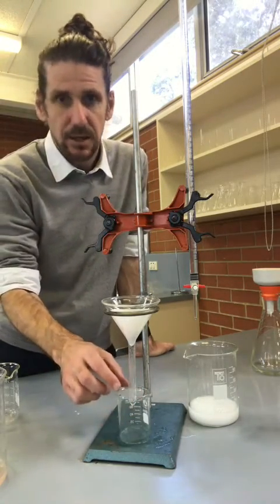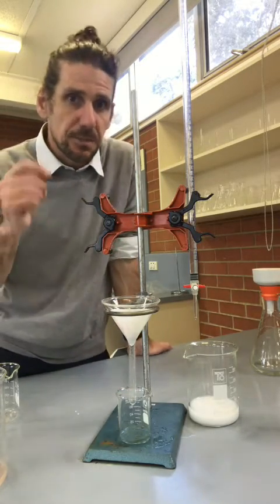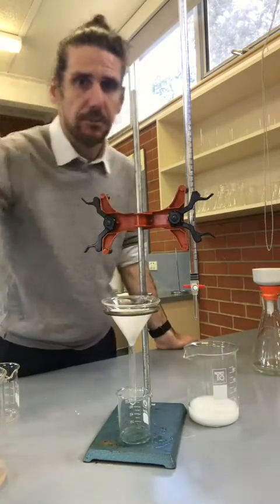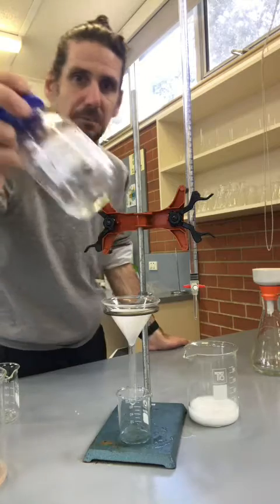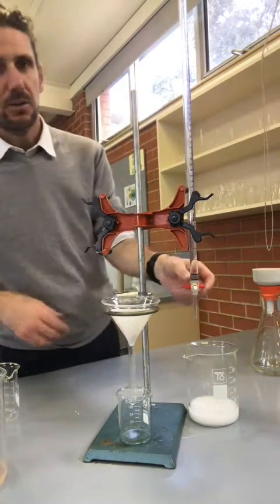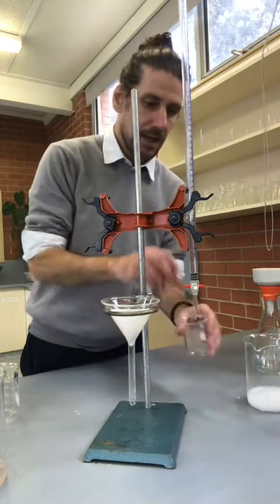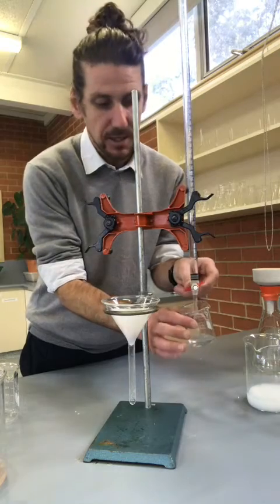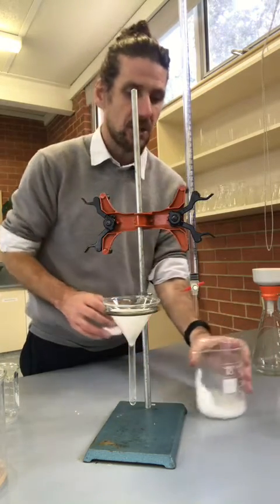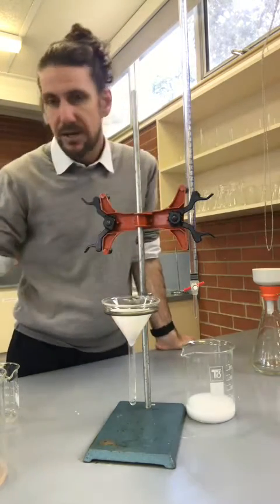Once we get our sulfate ions in there, the key thing with gravimetric analysis is you're doing a precipitation reaction. So what we did is we added barium chloride to the filtrate. When we add it, you see it starts to go cloudy, and that is the formation of our precipitate — barium sulfate.